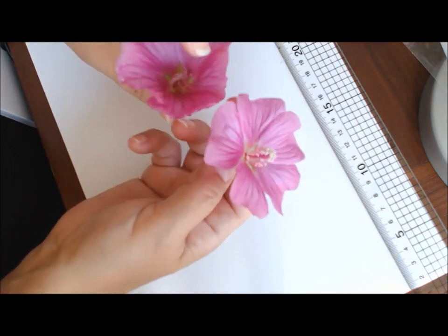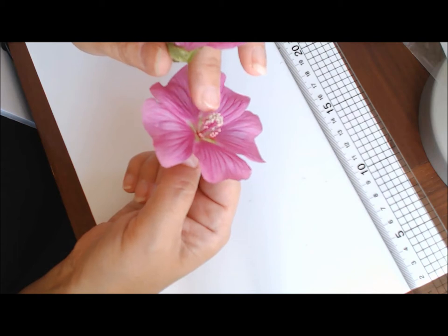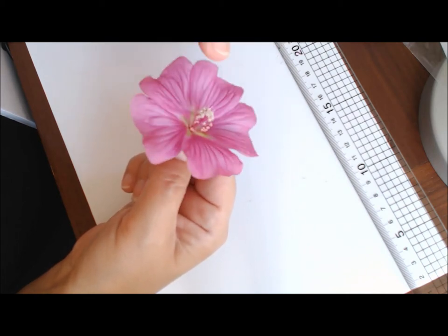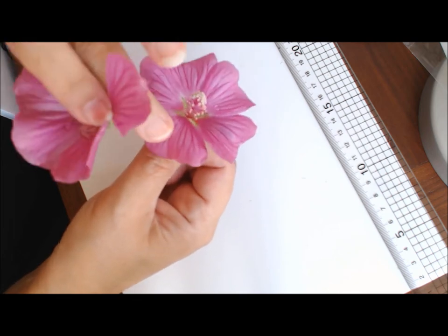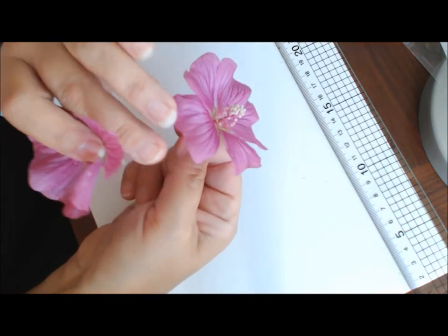What you can see inside is the male parts, the anthers, showing here. You can't actually see the stigma and style because it's encased within this column, within the flower.